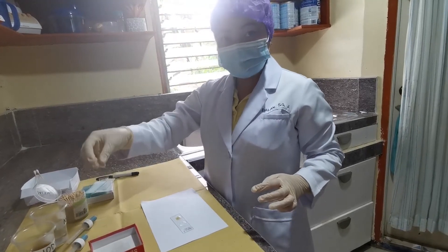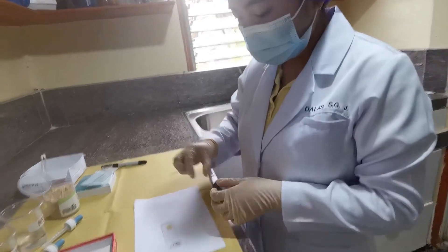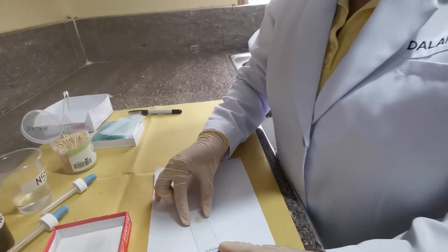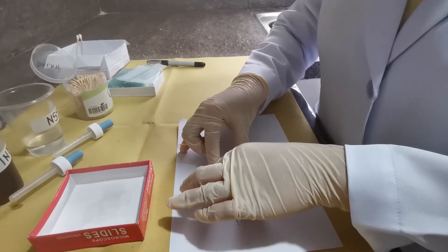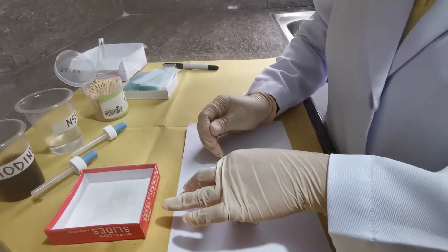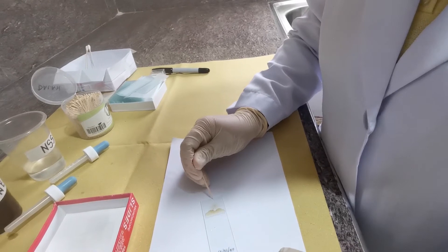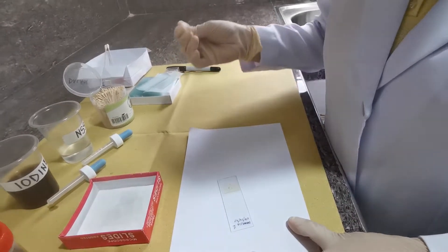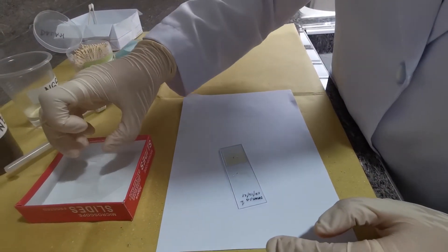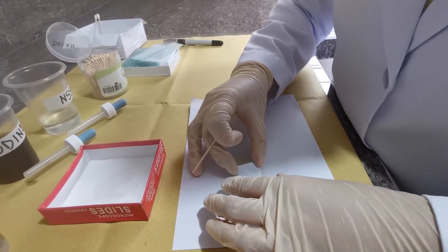So, next is to cover it with a cover slip. We have to make sure that it has no air bubbles. Then, another cover slip for the NSS solution.